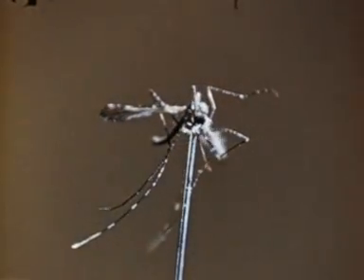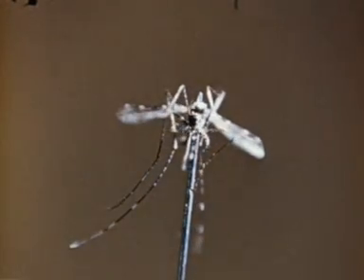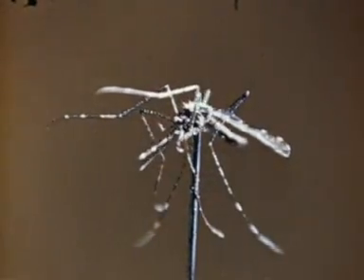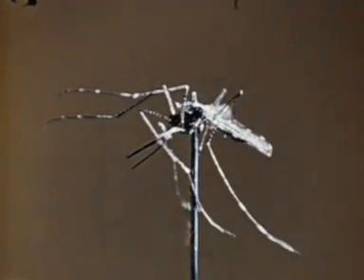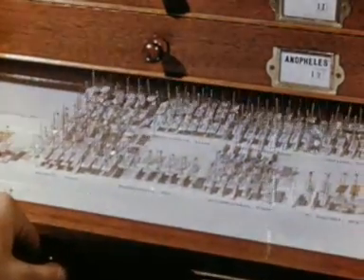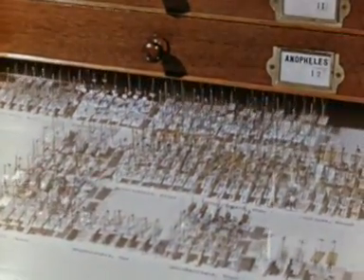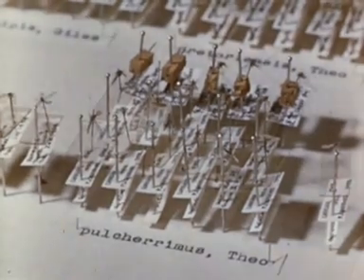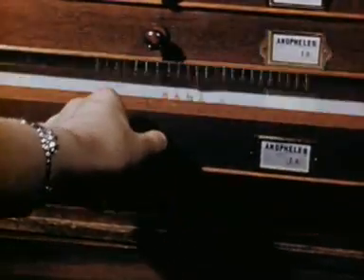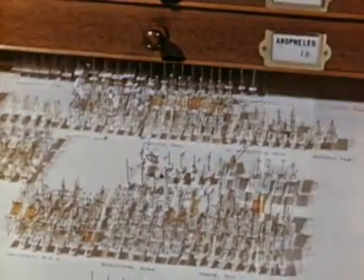The standard way of mounting insects is to pin them. This is both quickly and easily done and it requires very little equipment. It is equally useful for display, for storage or for sending specimens through the post, and so far no other method has replaced it. Here is part of the collection of Anopheles at the London School of Hygiene and Tropical Medicine. These insects have all been mounted and labelled and they are carefully preserved under glass for study and reference. They've been grouped both in species and also according to locality.